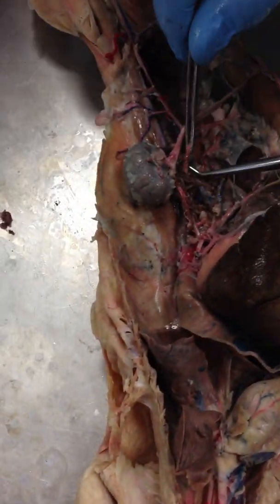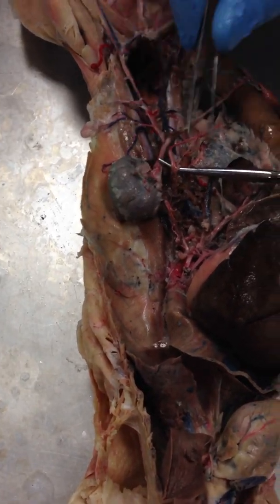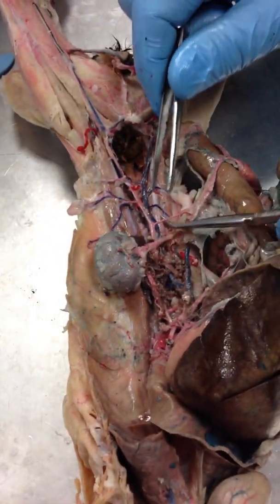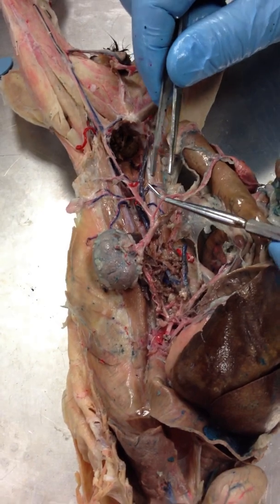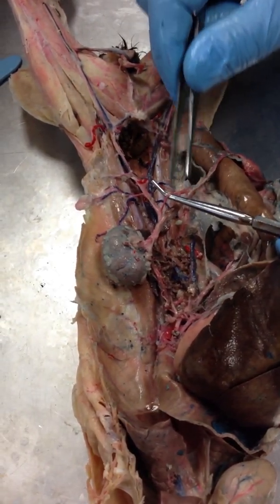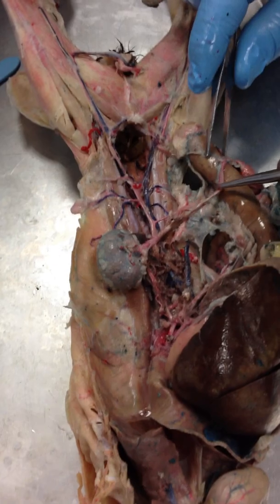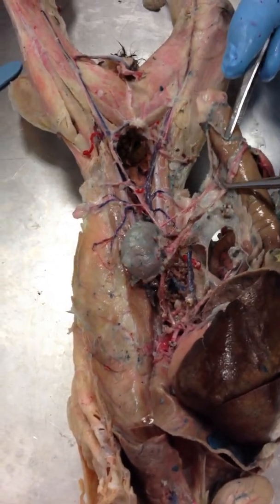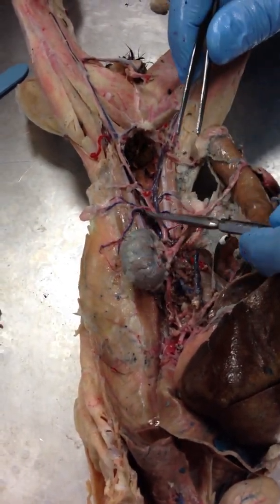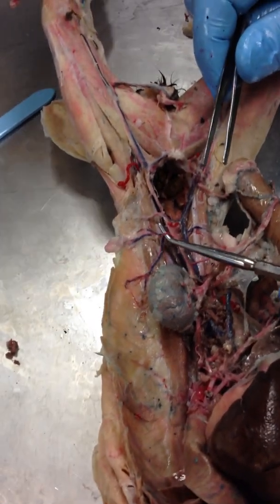Here is the descending abdominal aorta again, and then our next branch is this one. This is the posterior mesenteric artery going straight over to the large intestine. And then these are the ilio-lumbar artery and veins.